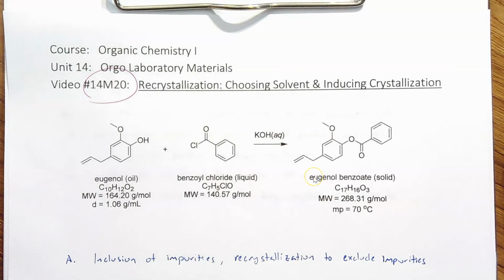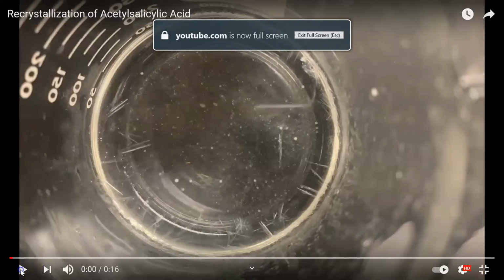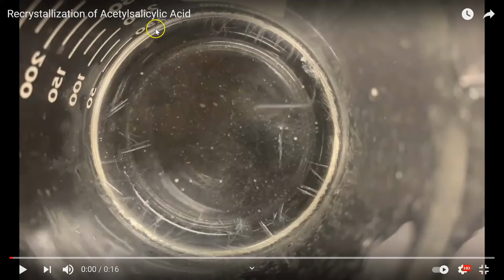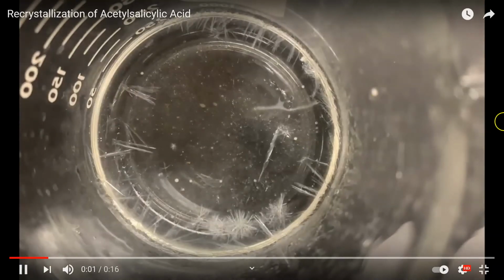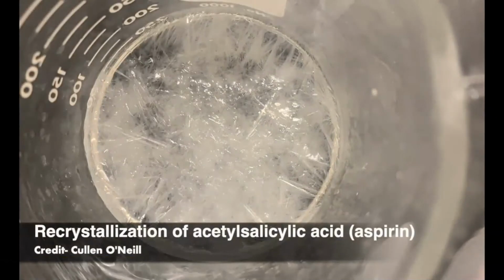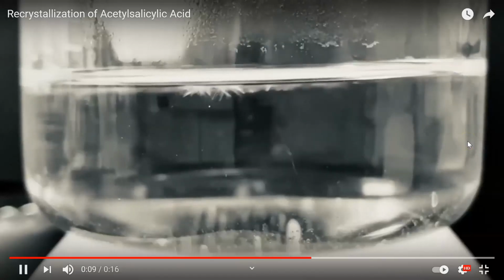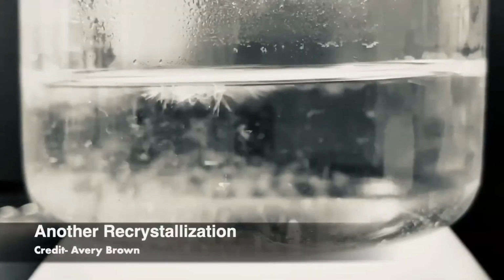I do want to leave you with one video, 15 seconds, of a recrystallization. This is a recrystallization of acetylsalicylic acid, which is aspirin. Okay. It's sped up, but you see that white, really shiny crystals form. These are pretty fine.